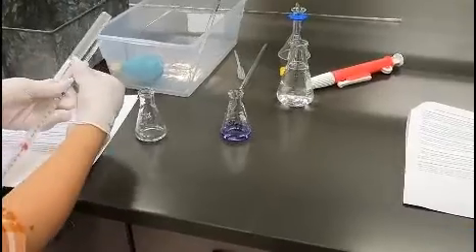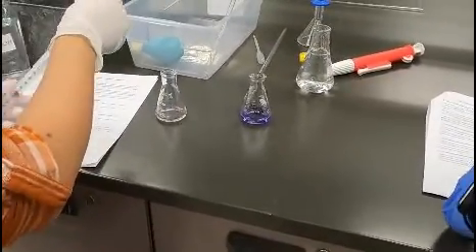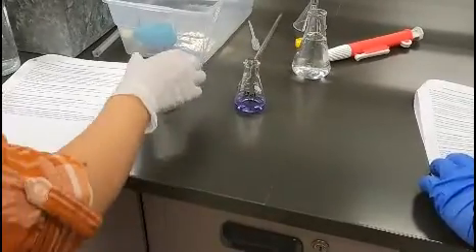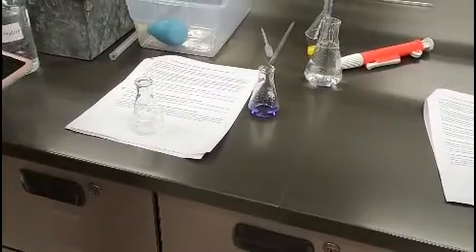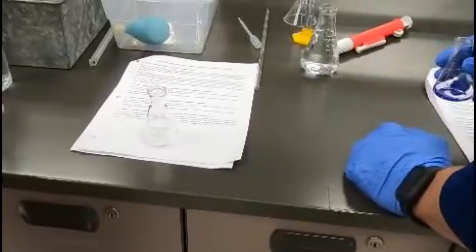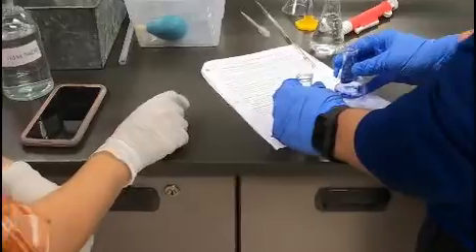Get through this first set, and I'm going to go away, but come get me before you guys leave so I can see your data. They don't have to see you do this four different times. He's going to time and call the color. I'm supposed to put it on top of white so you can see it better.